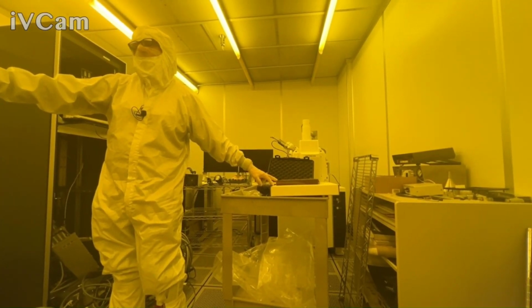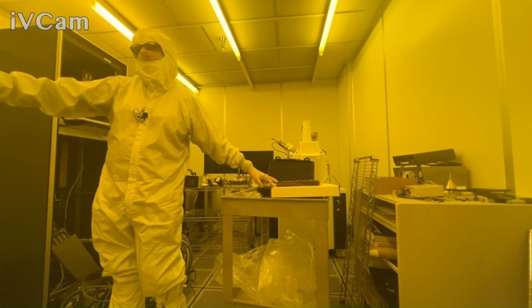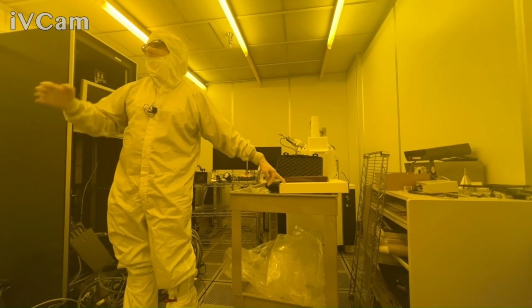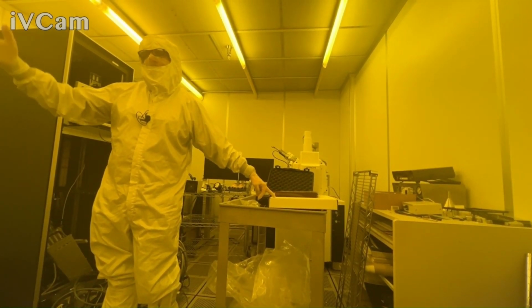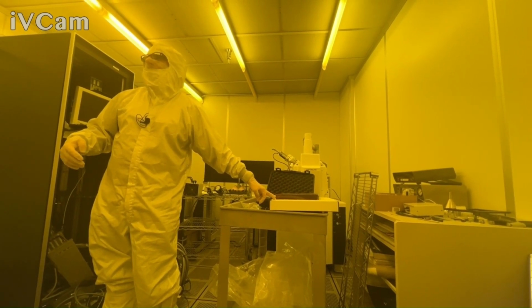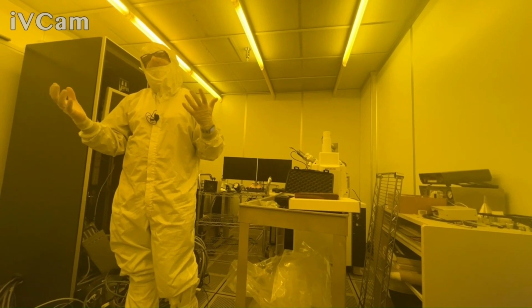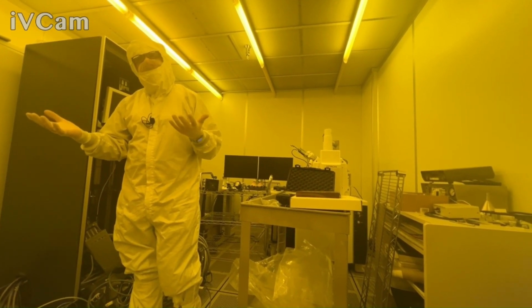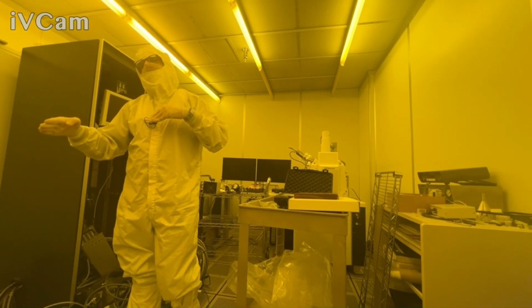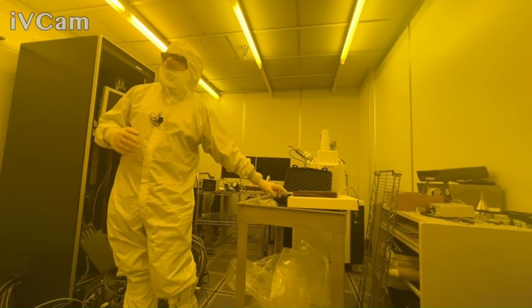Again, there are 2 fibers here. We're going to leave the red fiber on there because for the most part that covers the full range of this tool. There's a mid-IR fiber here that we would use if this was extended to 3 or 4 microns. We still ship it because this one crosses over in transmission around 2200, 2300 nanometers. This one will work out to 2500 nanometers. It's just starting to drop off quicker. So if you are doing a lot of work above 2300 nanometers, you could consider putting this one on.